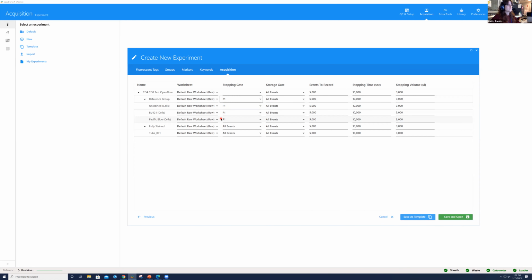Whenever we're doing our reference sample acquisition, we always work in the raw worksheet so we can see the full spectrum signature of our unstained and our single colors. I forego the storage gate. If I have a storage gate selected, anything outside of that gate will not be recorded. There are only very special applications for that, and it's not typically used very often. Here, for the amount of events I want to record, I'm going to select 20,000. That number is going to change depending on whether you're using beads or cells, and on population expression, to make sure you have enough positive events.